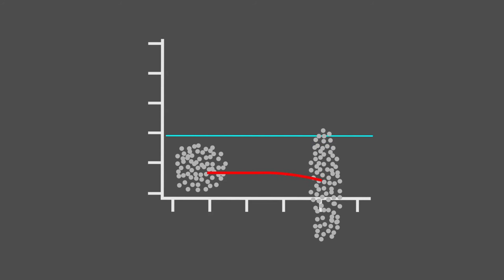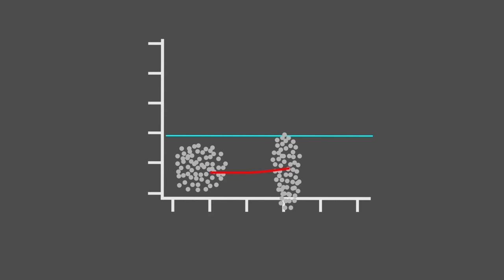If the marker has too strong an emission, we will tend to overcompensate, as we would have a natural tendency to try to align the two populations by the tops. A middle-level emission marker would suit us best.